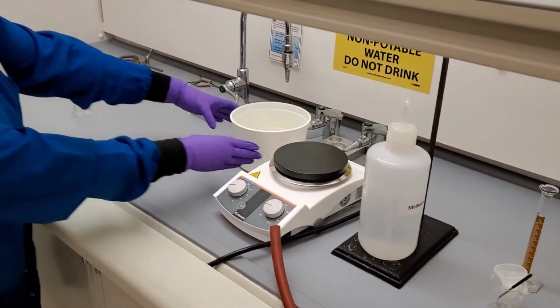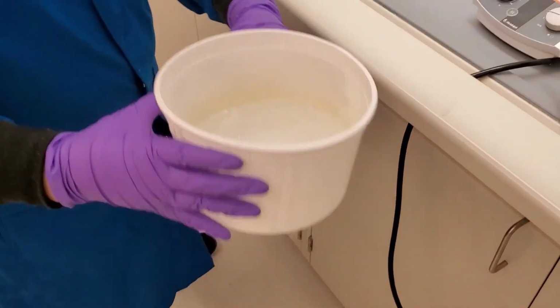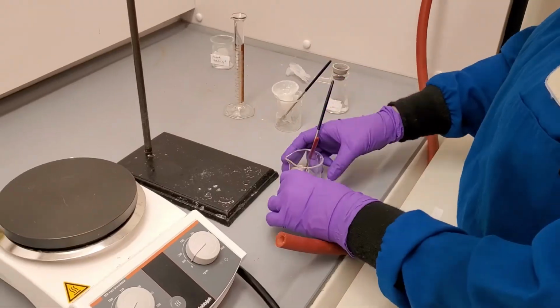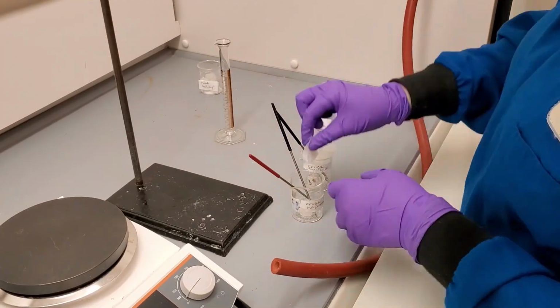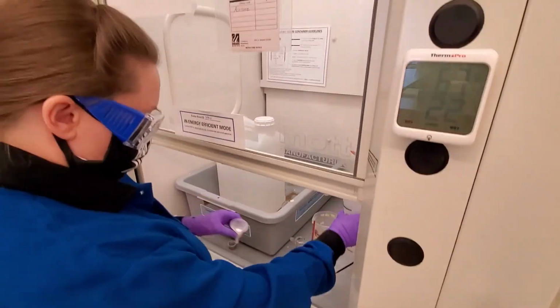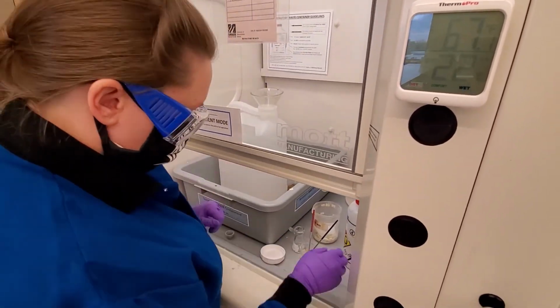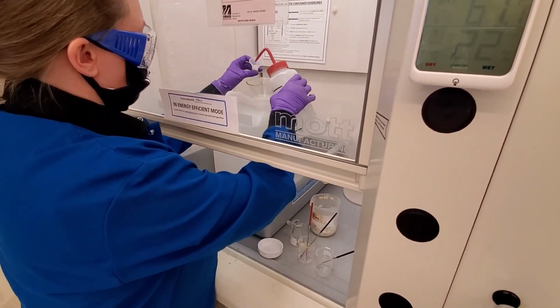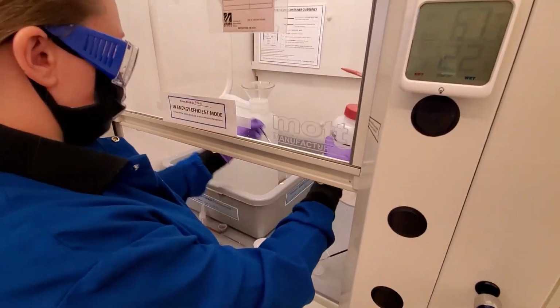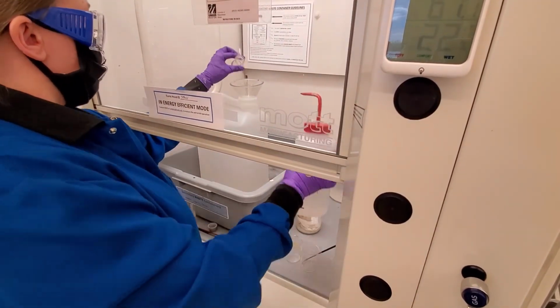The last thing to do before we leave is clean up our workspace. Dump the ice bath into the sink and hang the bucket to dry. Bring the equipment to the waste hood. Dispose of the solid waste in the solid waste container. In a normal semester, you would save your product for your TA to grade rather than disposing of it in the solid waste. Open the liquid waste and place the funnel on top.